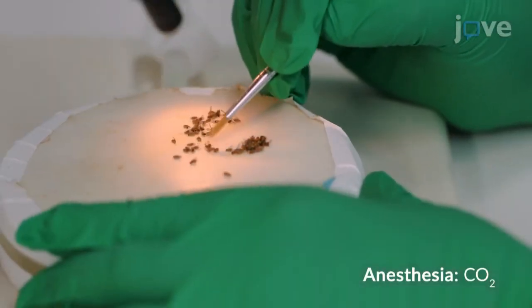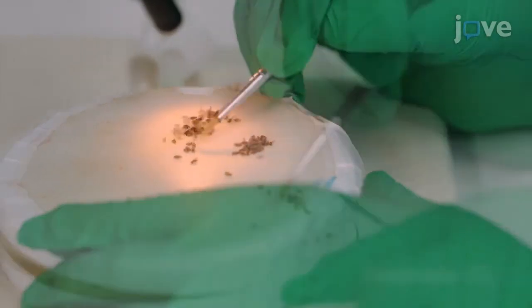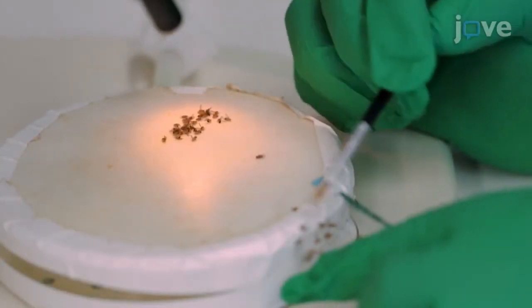Next, collect 0 to 2 days old non-virgin female Drosophila melanogaster flies and allow the flies to recover on standard cornmeal food.